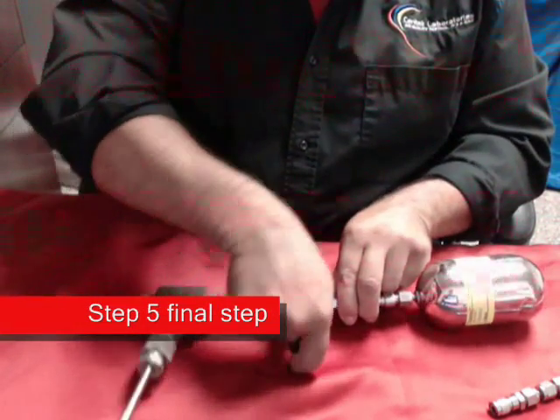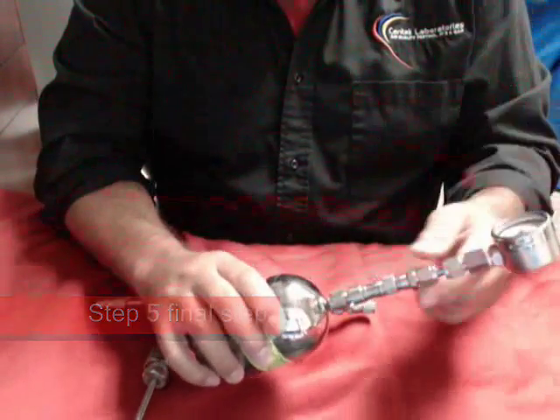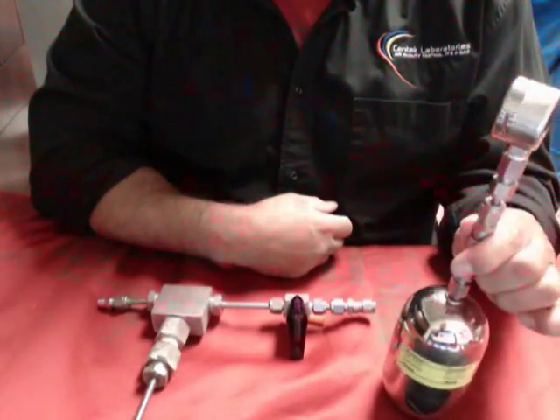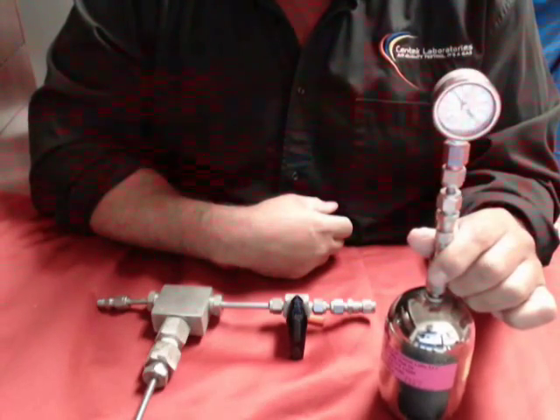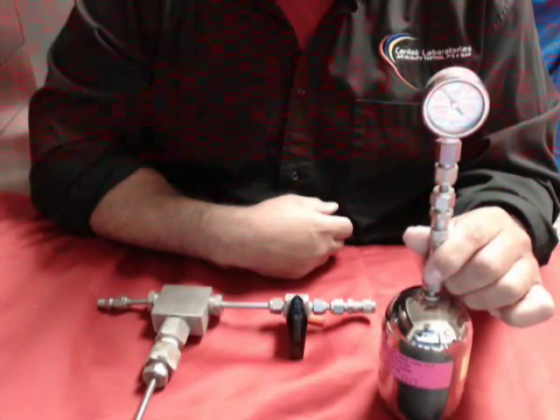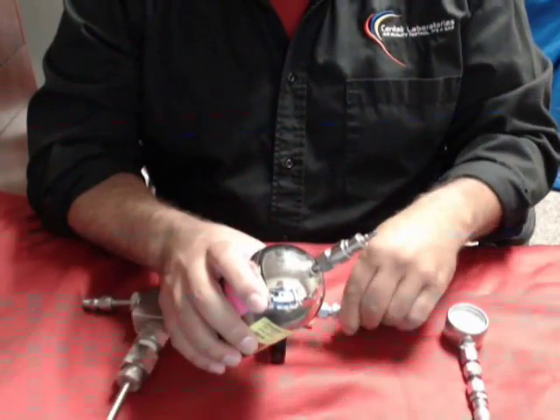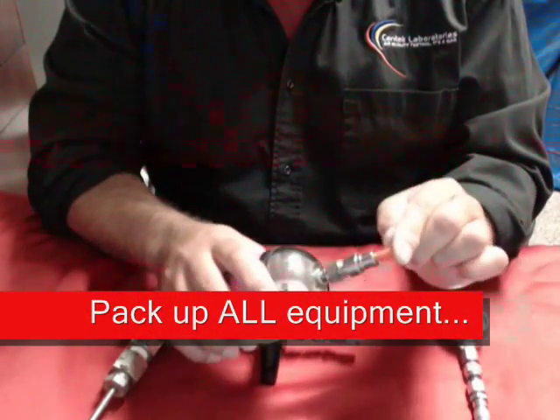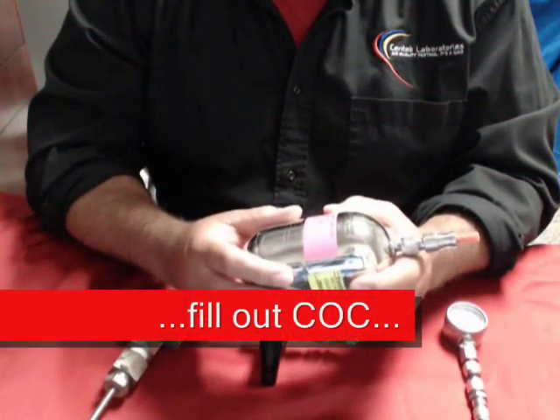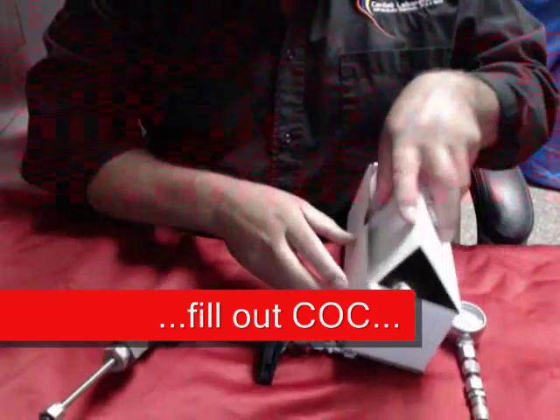When all is done, you're going to close your valve, disconnect, put your gauge on, and as you can see, we're now at around zero — ambient conditions. We could still pull a small amount of sample, but we really need to be at at least 5 psi. Once this is done, disconnect your gauge, put the cap back on, fill out all the paperwork and labels that will be put onto your canister, put it back into the box, and you're done.